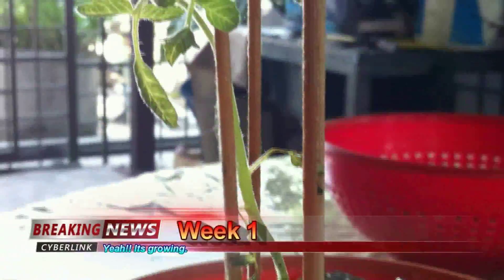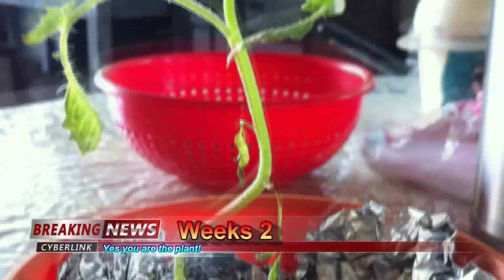Lastly, the plant is watered daily. At the same time, the morphology and growth of the plants are observed for any abnormal characteristics. The observation is done for a duration of 4 weeks.